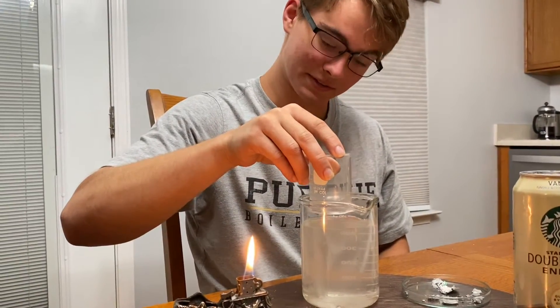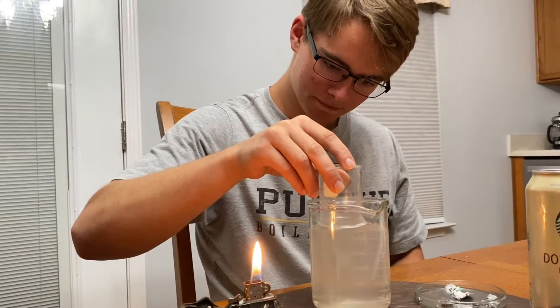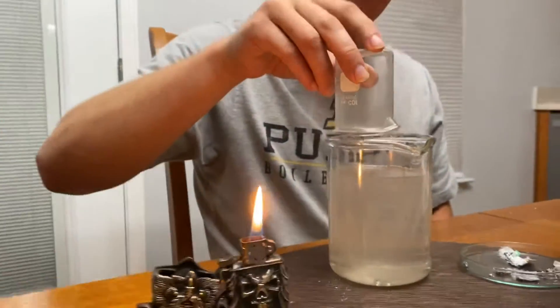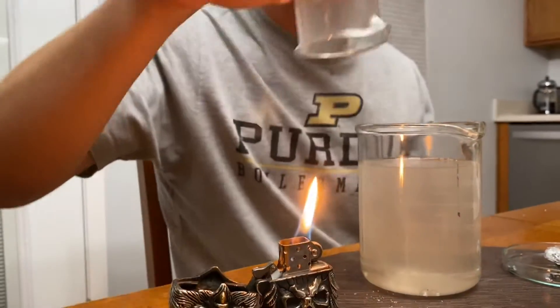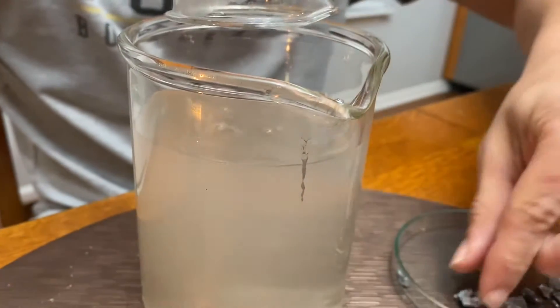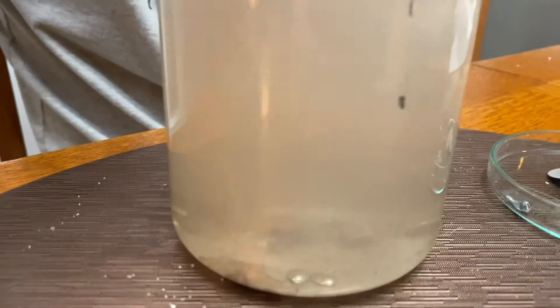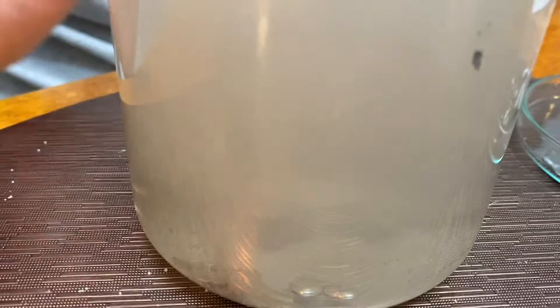We need more hydrogen — let's put in some more chunks, maybe two or three more. Let's generate lots of hydrogen. I can see it bubbling down there at the bottom, so it's definitely releasing hydrogen — you've got a good chemical reaction going. Maybe get the beaker a little closer to the surface so no hydrogen escapes. We may not be trapping enough. Let's add a few more chunks.